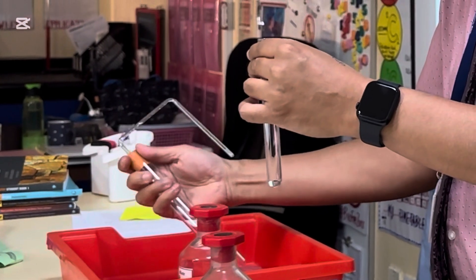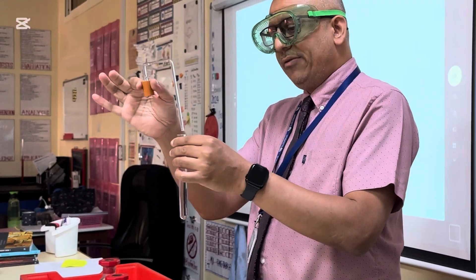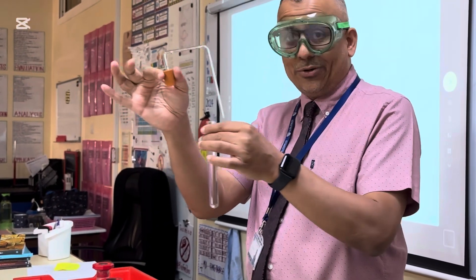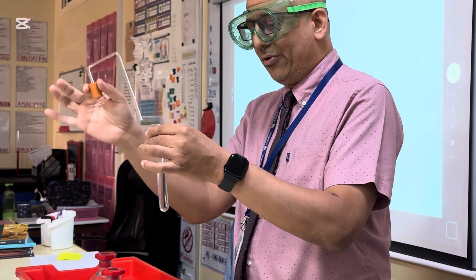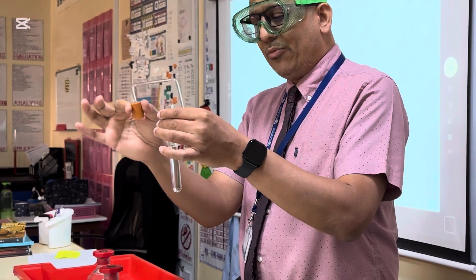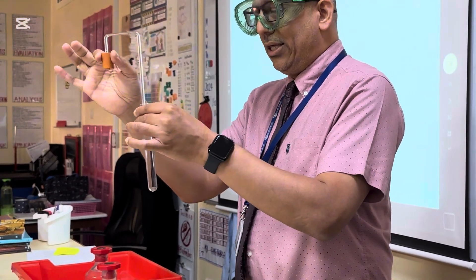I'll just disconnect it. This is called a delivery tube, and the delivery tube is what we use to transfer gases from where a chemical reaction is into perhaps something that we want to use to test the gas.